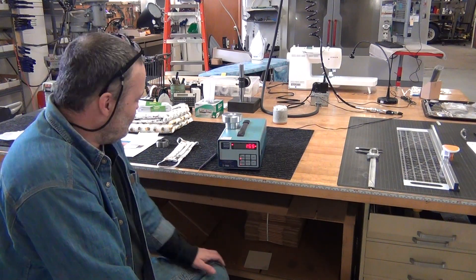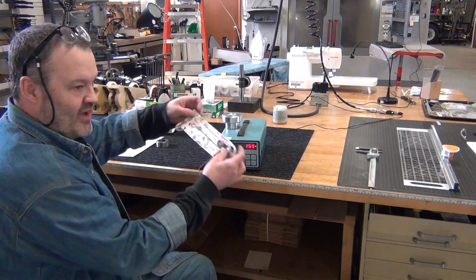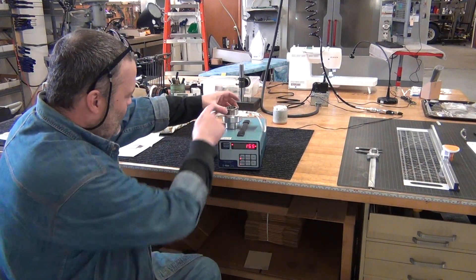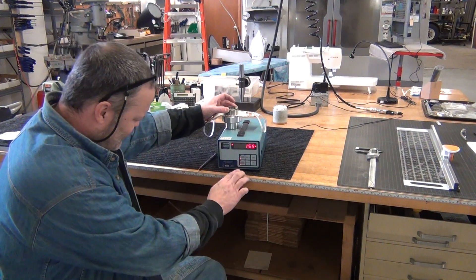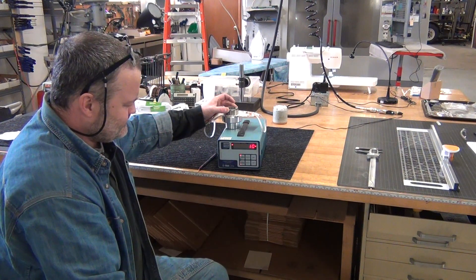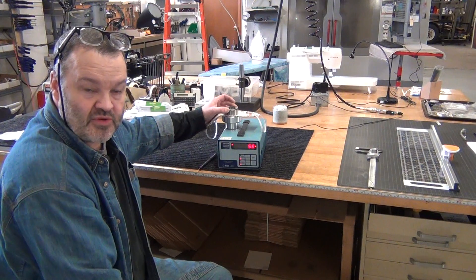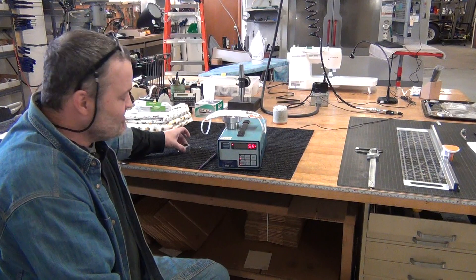155 is our baseline. Now let's try one of my homemade masks and see if it helps at one micron. I'm just putting it on there — there's a one-inch circular hole so it doesn't make much back pressure and I'm holding it down with that circular die. Let's see what this does.